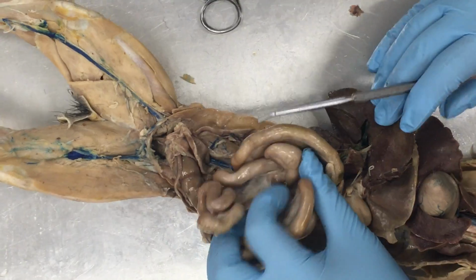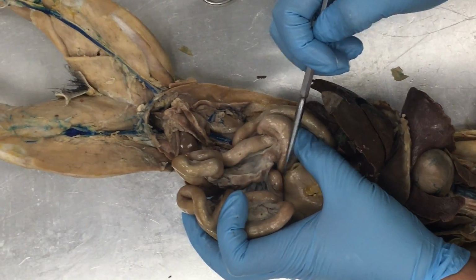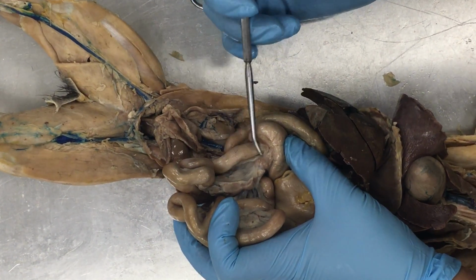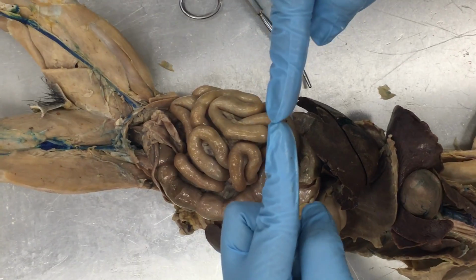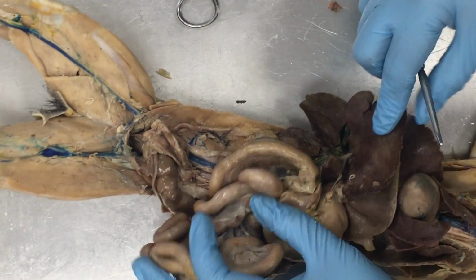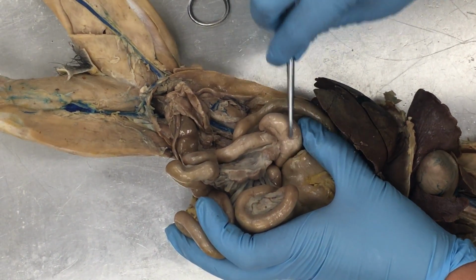The easiest way to find the ileum is to just kind of look around your intestines, and then you'll get to a point where one intestine runs into the side of the other. This is the end of our small intestine. This is our ileum. And it actually runs into the side of our large intestine. So instead of kind of meeting end on end, they come together like this. So this last portion of our small intestine, that's our ileum. Then it meets up with our large intestine here.